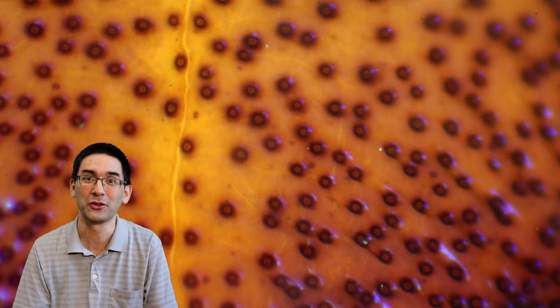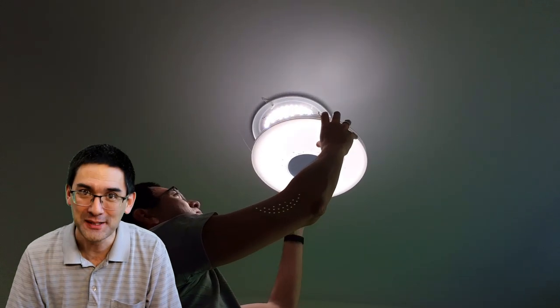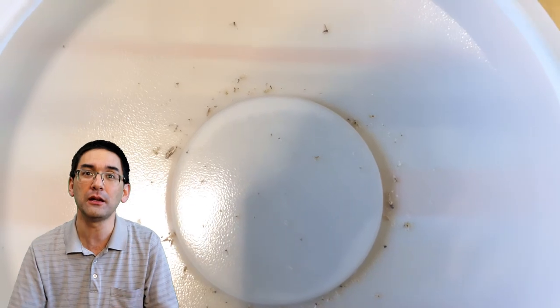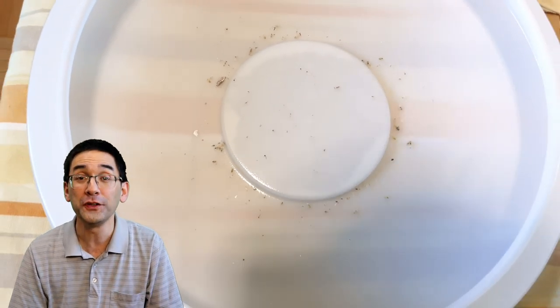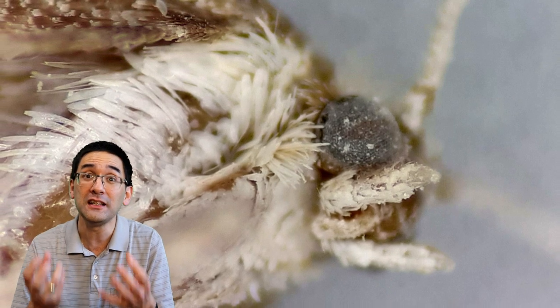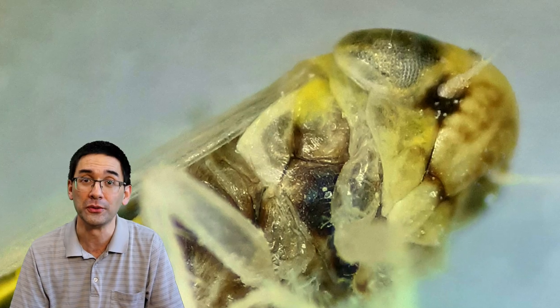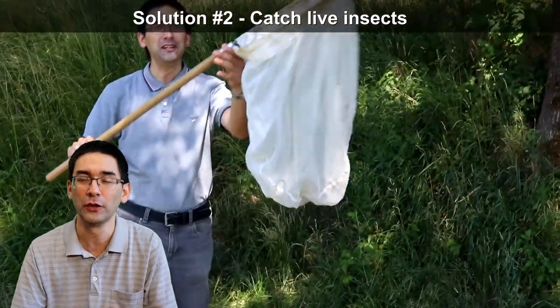Those two beetles are quite nice as well. Also, check your lamps — they attract insects and sometimes insects accumulate there. Very often they appear quite bright and white because the intense light has bleached them out, though they're pretty fragile and tend to fall apart.